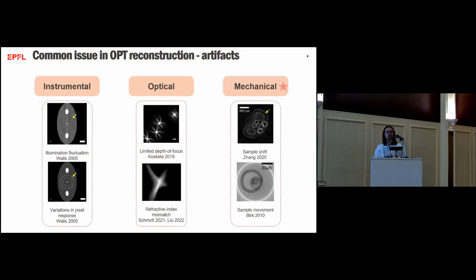While this whole pipeline works very nicely, there's a common issue in OPT reconstructions: the artifacts. The artifacts can happen due to different reasons. They can be instrumental reasons. For instance, if we have some fluctuation in the light source or some pixel variations in the detector response, we see these smear and ring artifacts. Artifacts can also happen due to optical reasons. For instance, due to the limited depth of focus, we have these arms and legs that appear around what is supposed to be a point in the reconstruction. Artifacts can also happen due to, for instance, refractive index mismatch, if you noticed my poster yesterday. And today we're going to focus on the last category, the mechanical artifacts in the system. For instance, the sample may move or be shifted during the experiment.